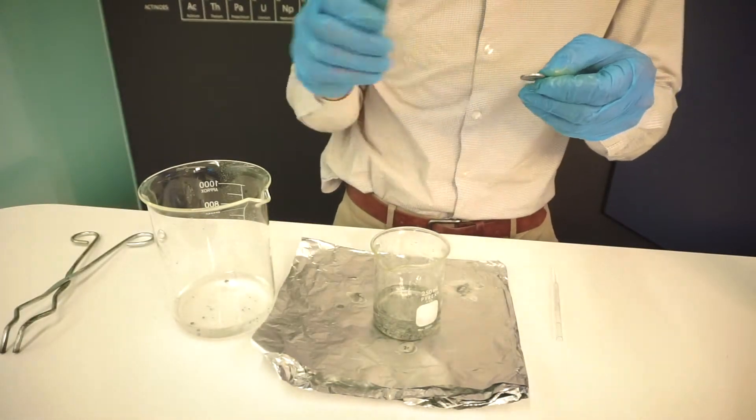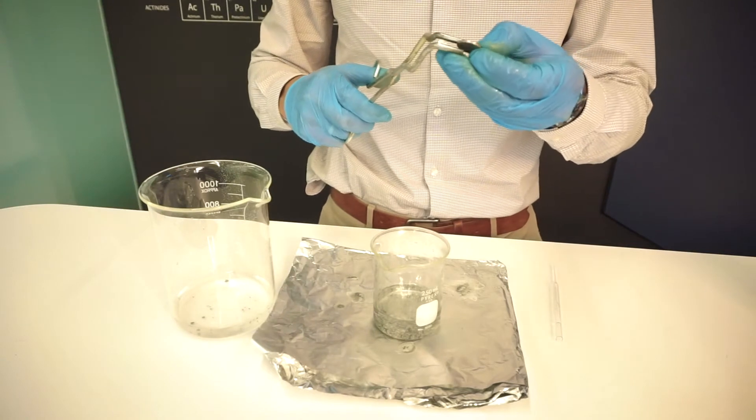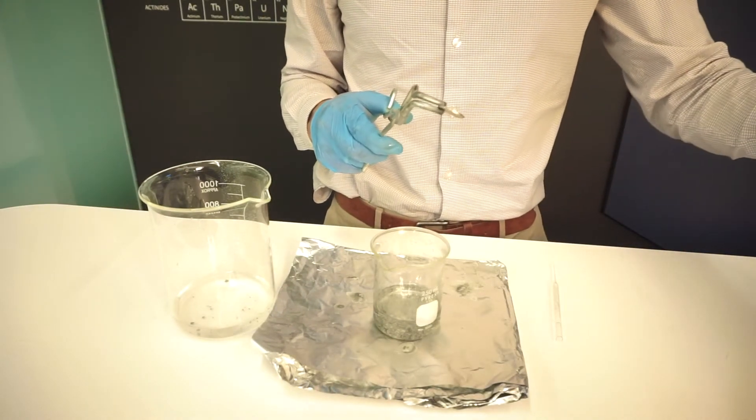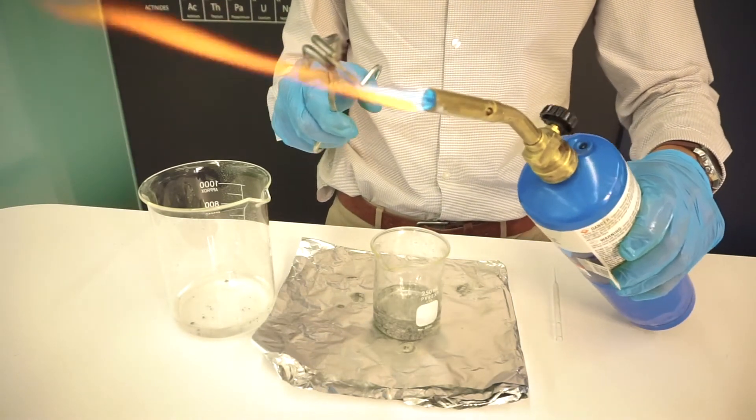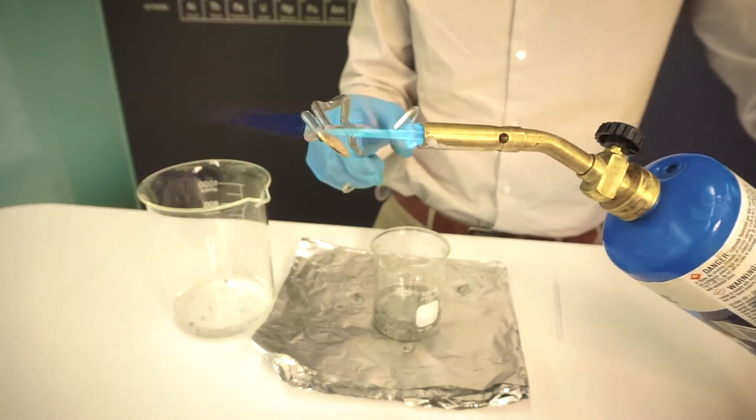So now what we're going to do is we're going to see what happens when we heat this up. And so I'm going to take a butane torch and just gently heat this.